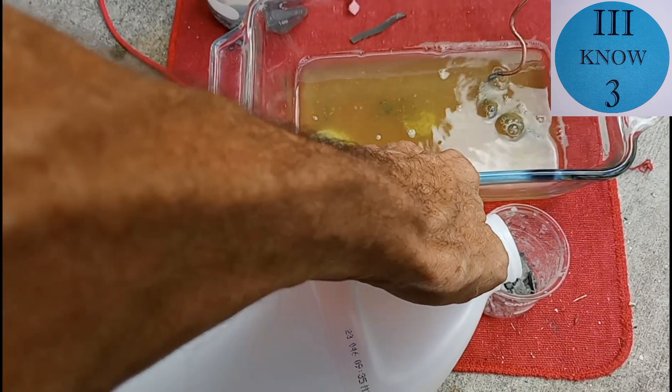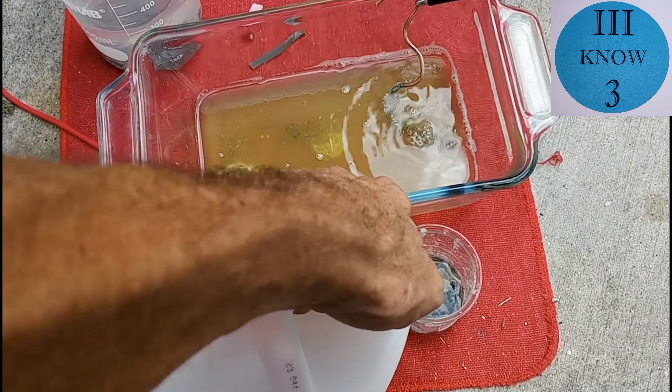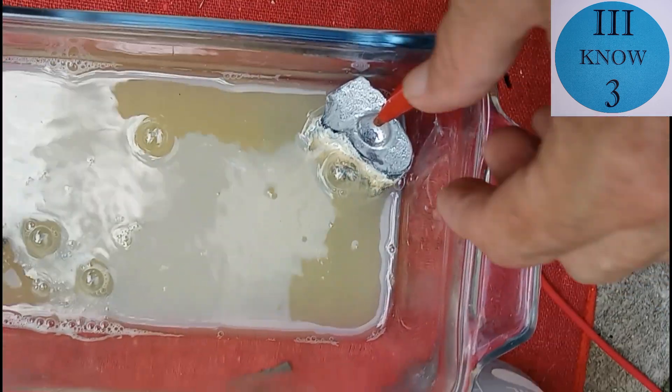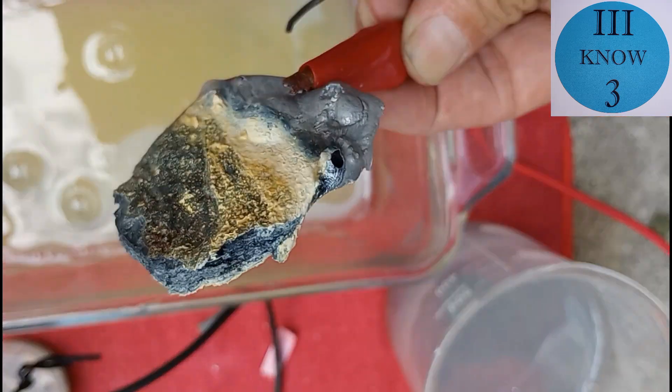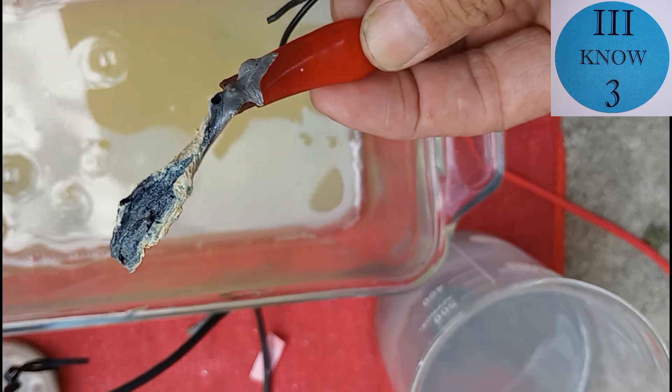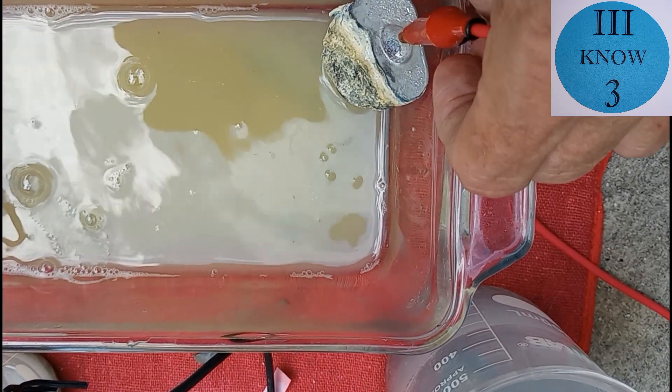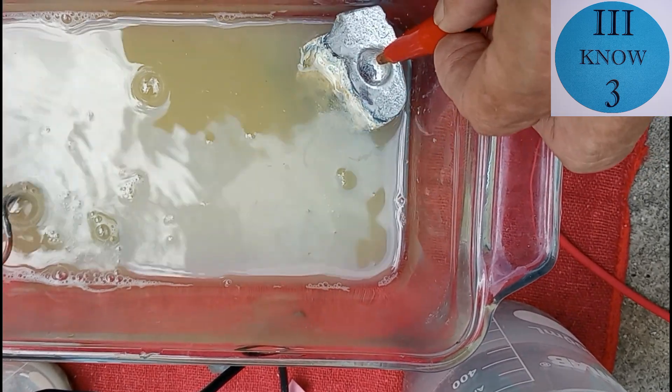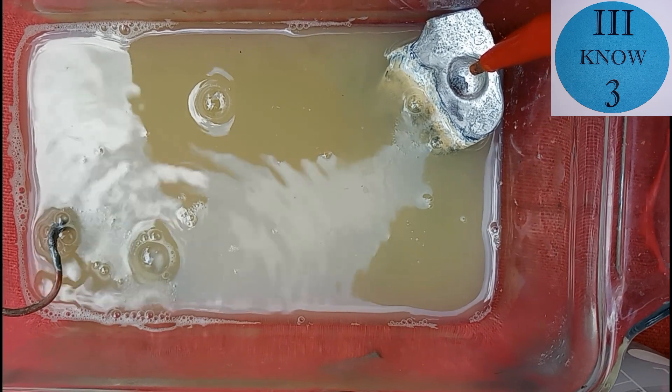While we have the cell running, I thought I would put a little bit of sulfuric acid on the undissolved tin pieces just to see what would happen. So it's getting late and I'm probably going to start breaking this down soon since I'm outside. But that's really interesting, how it looks like it's split open and the tin on the inside is black. It's times like these I wish I had an indoor space so I could let this run overnight.